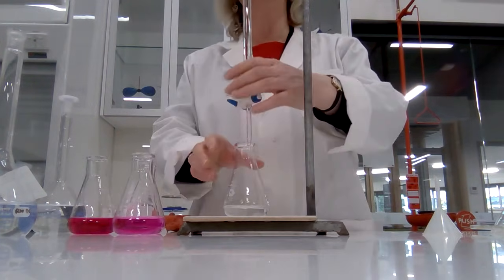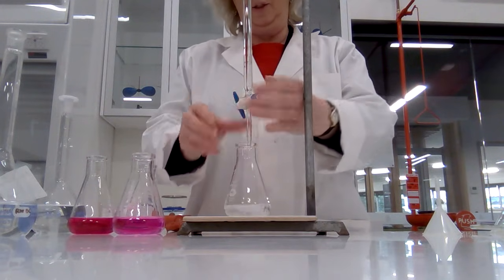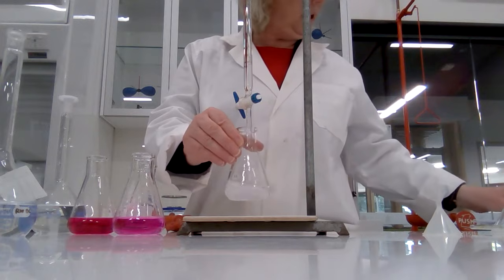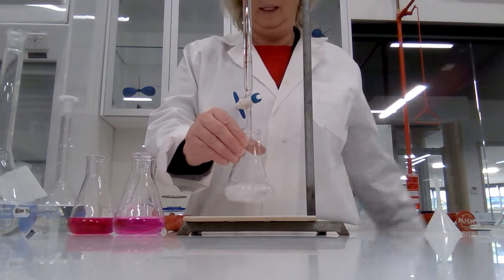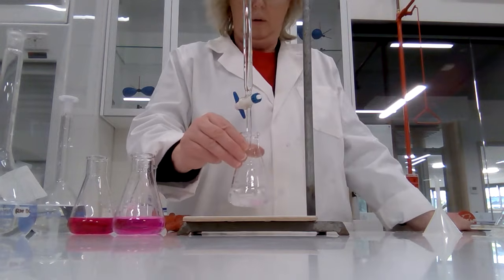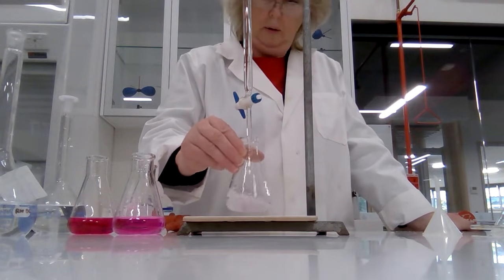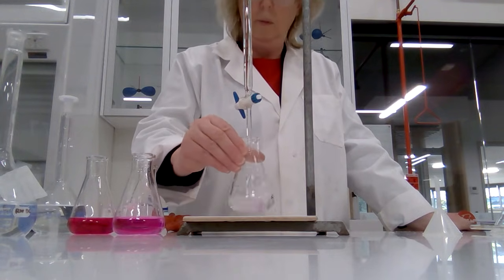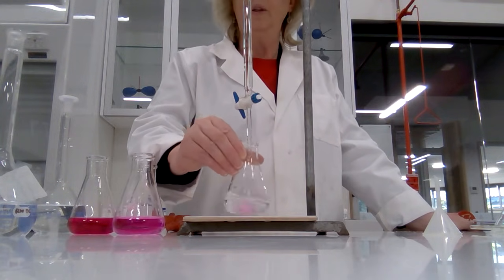Right, we're starting the next one and away we go. Started off at 20.80 and I expect to go down to 40.80 if all is well. So going down, down, down, closer.